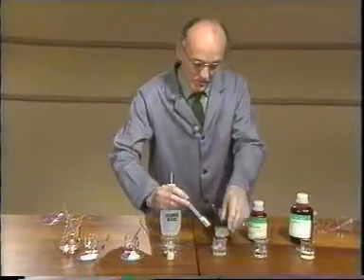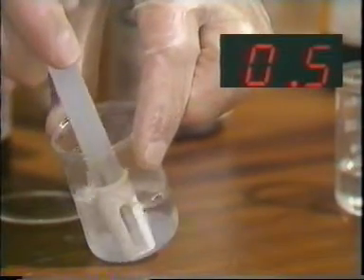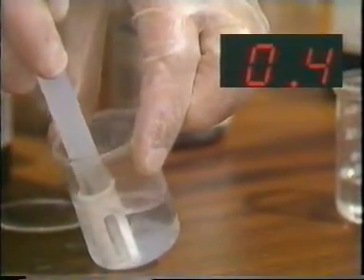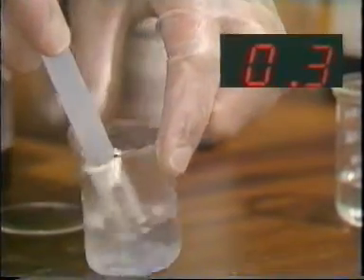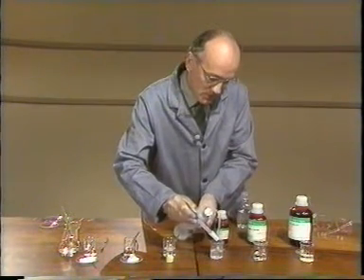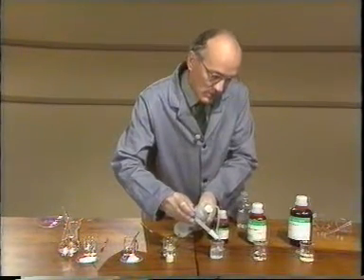On to the next one, the silicon tetrachloride. And you can see here that the pH has dropped right down to 0.4, 0.3 even. Rinse the probe carefully. I have to be very careful this time because you noticed there is some solid in this beaker. You should be able to work out what that is.